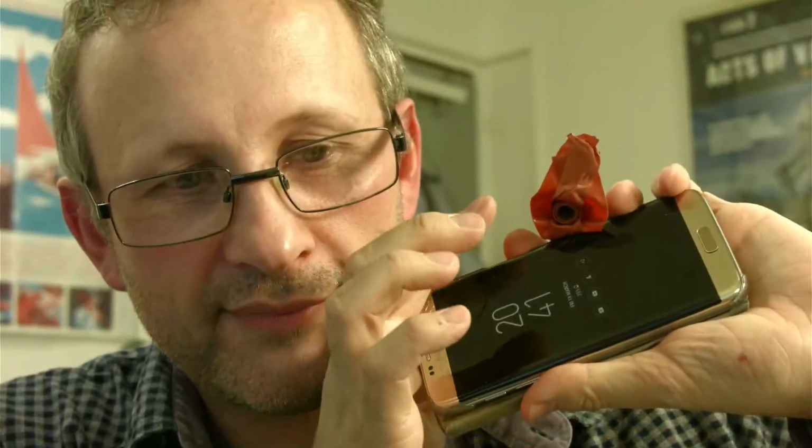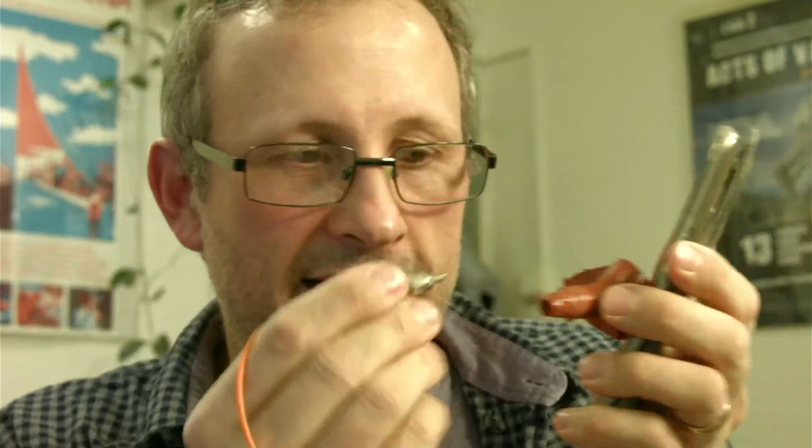But before I get there, I just want to talk about what I came up with. So I came up with this. This is a sample container, and I cut a hole in it, and I've made effectively a gland, and I can insert this into that, and we will do that.